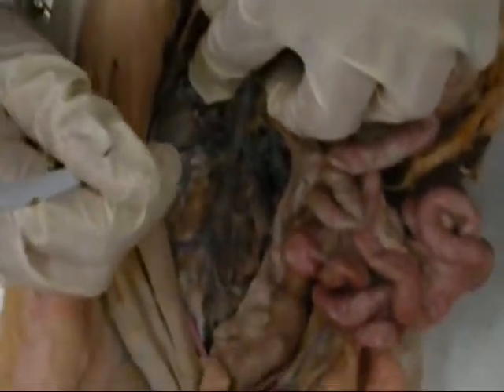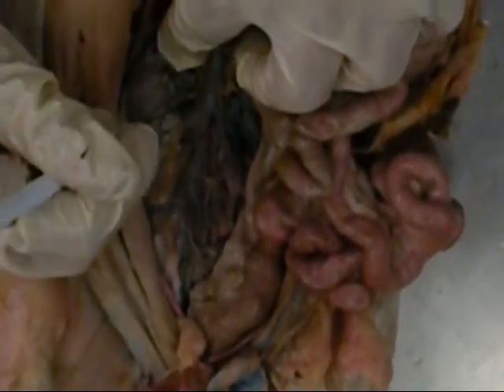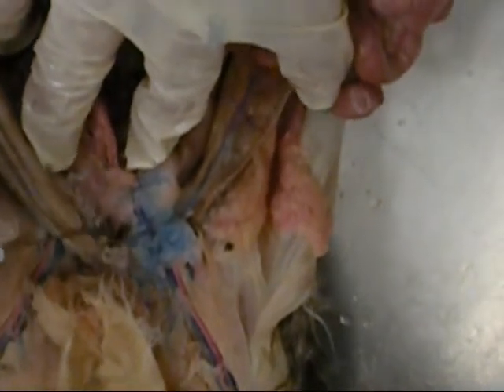If we clear away some of this fat, we can see the renal artery and renal vein. The vein is inferior and superficial on the ventral side, and obviously color-coded in blue. Exiting the kidney here, we have the tube of the ureter, and the ureter is going to take us down to the urinary bladder. You can see the ureters enter on the posterior side of the urinary bladder. Exiting from the anterior surface, inferiorly, is the urethra. So those are the urinary system structures from the cat.